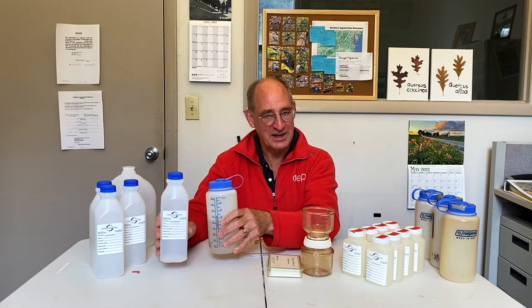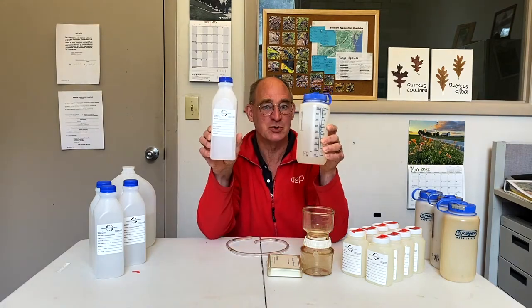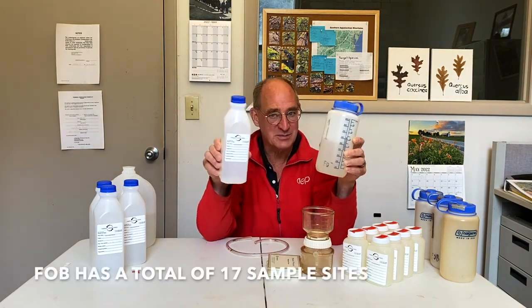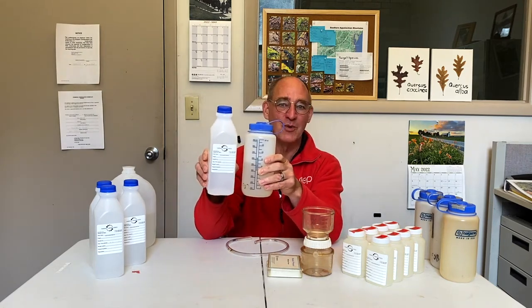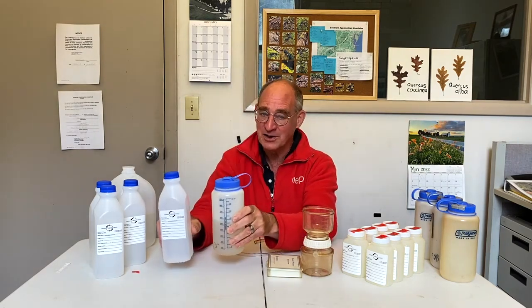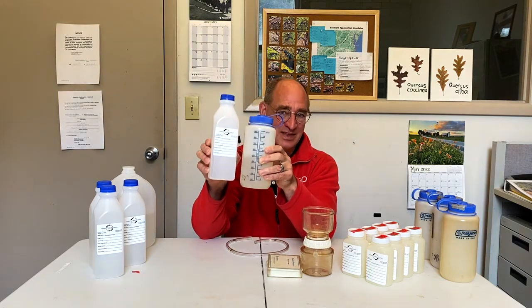We are explaining this as if we had just come in from the field, and what we did in the field is we filled these 2 bottles of water from various streams and various tributaries and various seeps of mine drainage or other water that we wanted to know what was going on with. We filled these 2 bottles very carefully, being careful not to put our fingers on the rim or to smudge up the inside of the caps so that we don't contaminate that water at all.